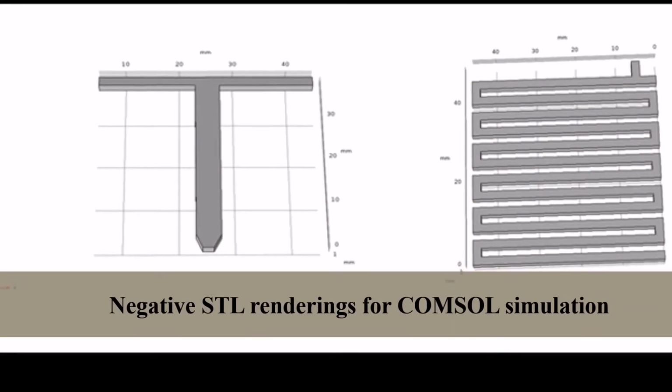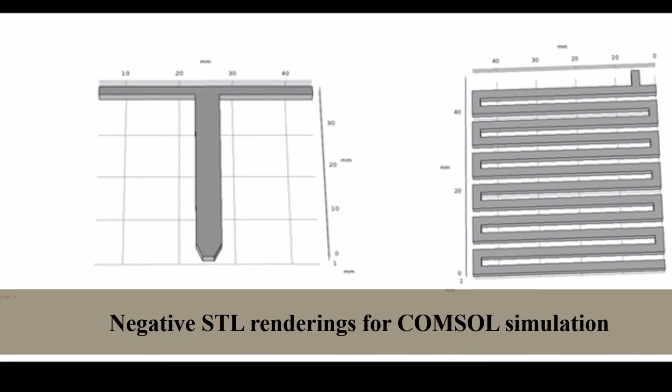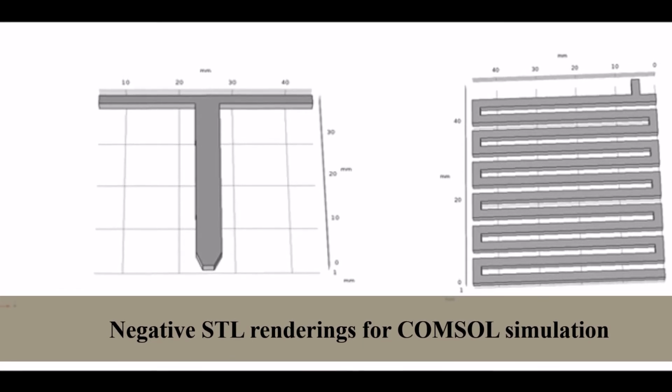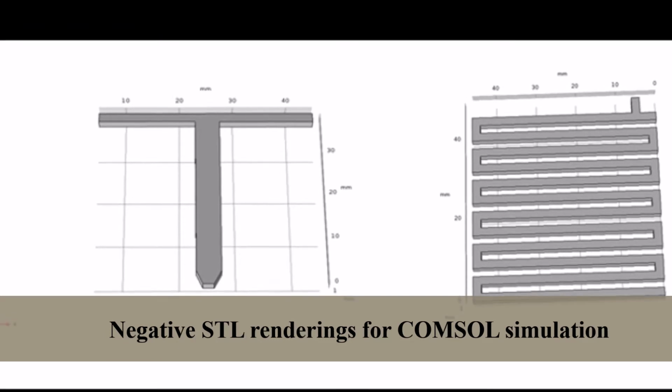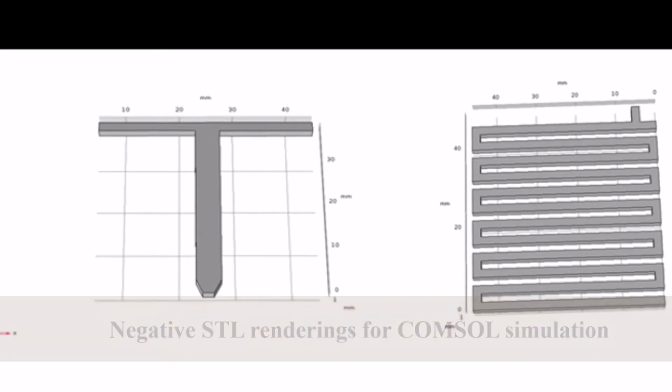Reactor designs were simulated in COMSOL prior to experimentation. The goal of the COMSOL simulations was to verify that our second design iteration performed better than the T-reactor before printing. This approach saved us time, printing materials, and reagents.